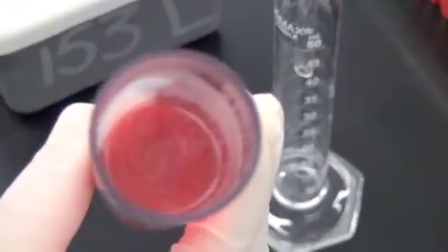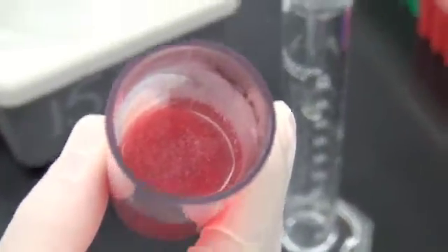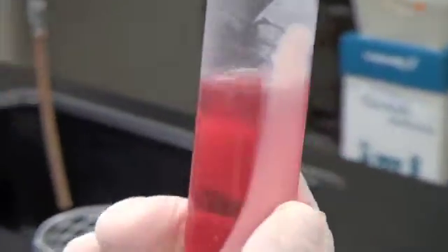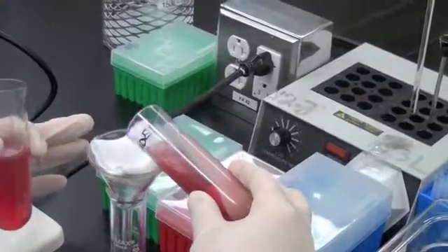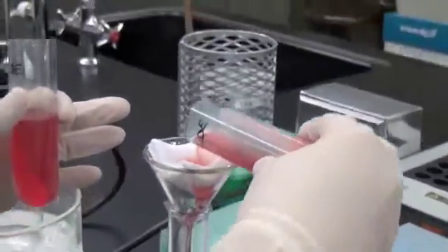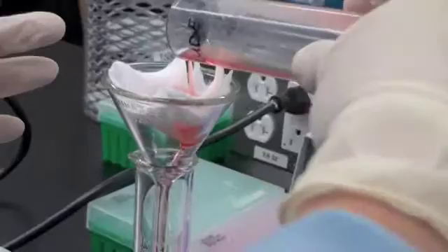Dr. Beckman, what's that stuff floating up top? That's insoluble fibrous tissue, which likely contains proteoglycan fibers that are less dense than the solvent. Biochemist Dicer is ready to decant her sample. Look how the pellet is rather large and strewn across one side of the tube.